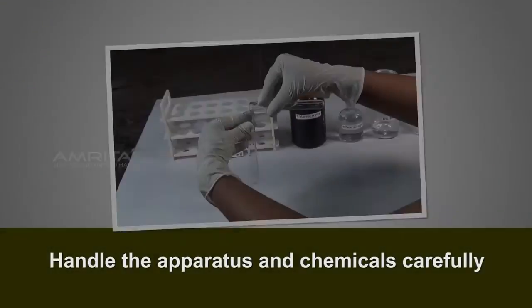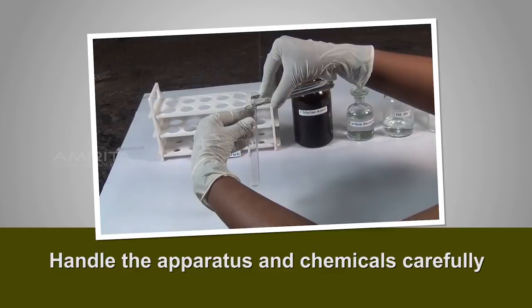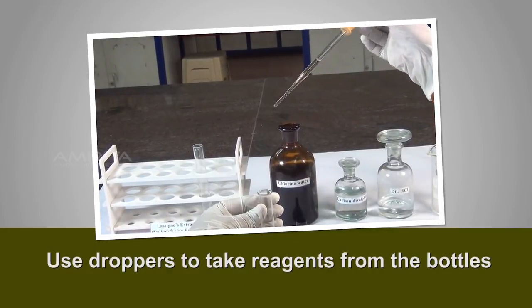Precautions: Handle the apparatus and chemicals carefully. Use droppers to take reagents from the bottles.